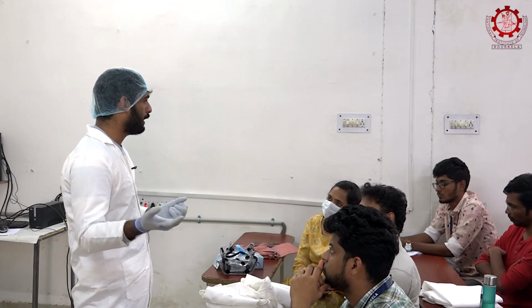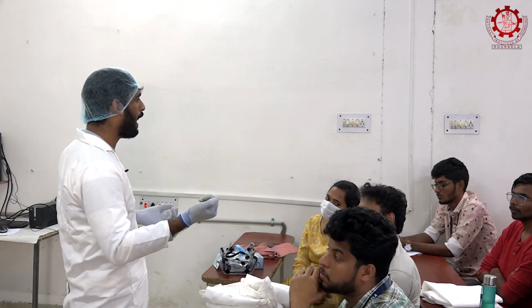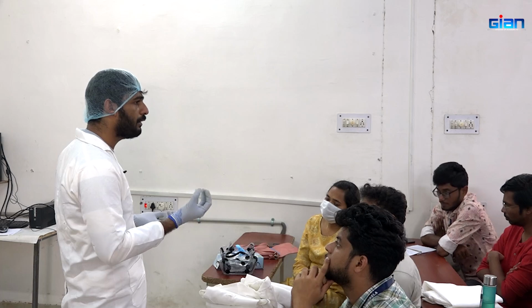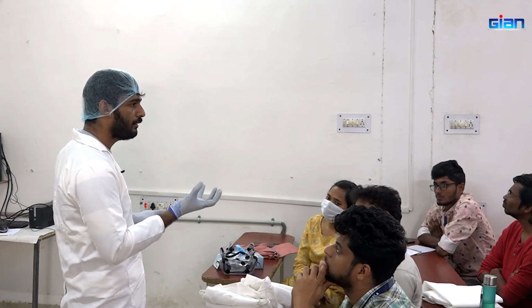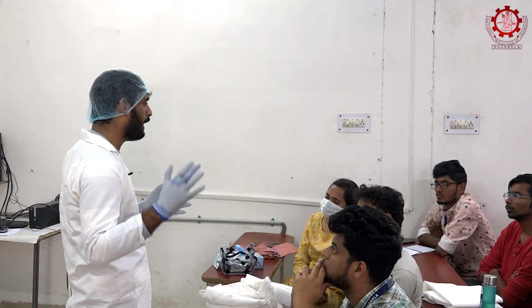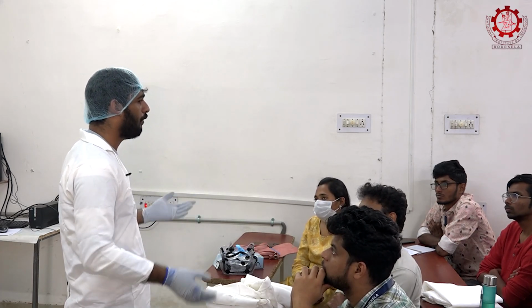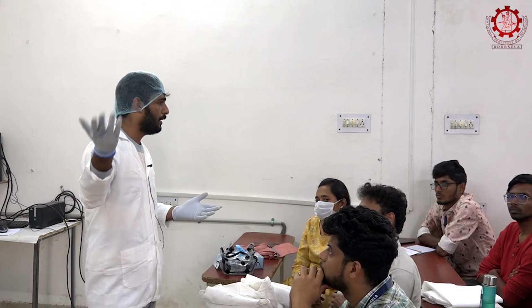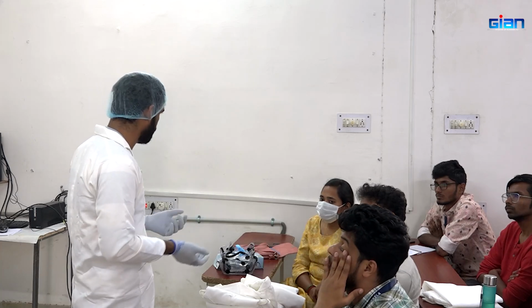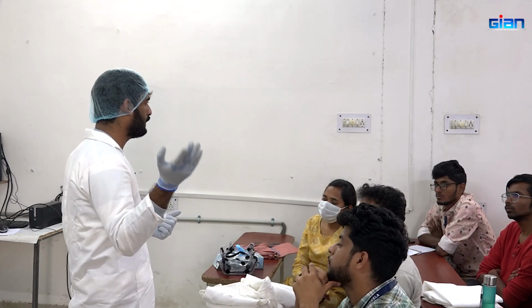For example, dairy products. When we are slowly adding citric acid, at a point it will coagulate and we will be getting the casein, coagulated calcium caseinate, or the casein fraction. That will be pressed, then we will be making paneer, or if you want to go for cheese, there is another set of processes. Similarly, here also we will be precipitating the protein fraction by using the isoelectric point.